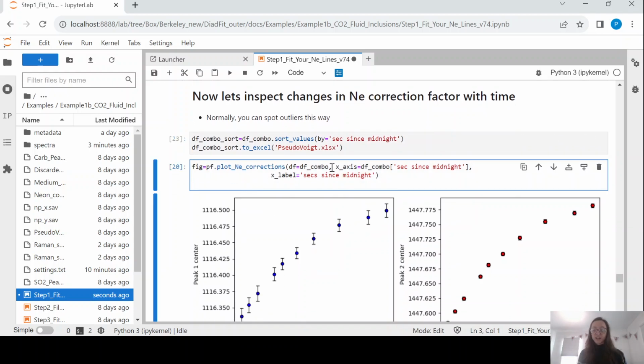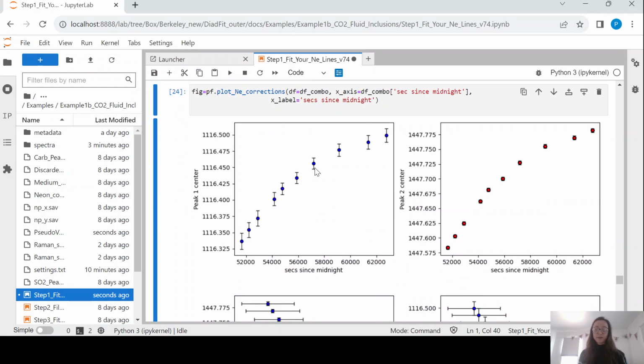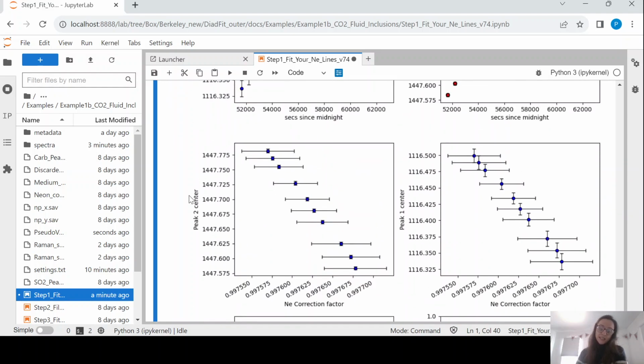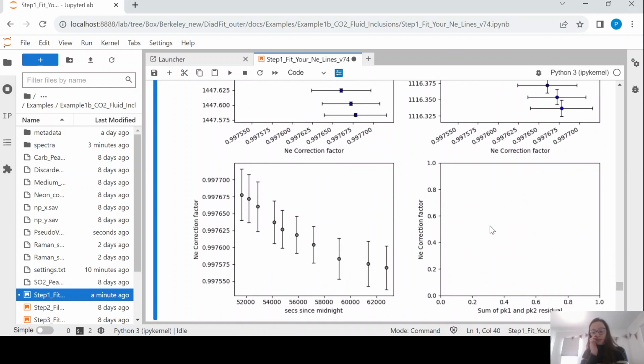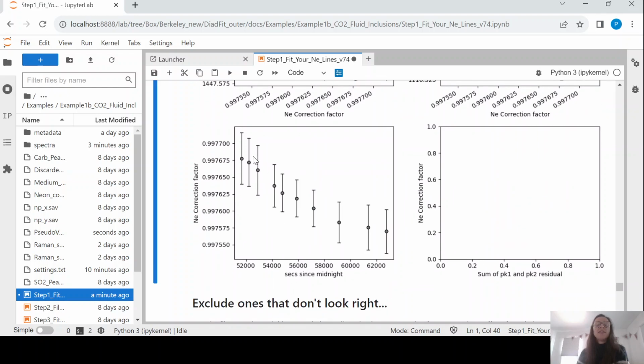And then we're going to use this function which takes the data frame you've combined and plots some peak parameters. What it plots to start with is the position of peak 1. So that is that 1116, 1117 peak, and it's plotting it against time. So you can see this peak position is drifting through time. This matches temperature in our lab really, really well. This is a known problem, and this is why we're doing this correction. I'm also plotting things like the peak 2 center against the neon correction factor, just so you could see. The most important plot by far is this one, the neon correction factor versus the seconds since midnight. This shows how our instrument is drifting through the day.